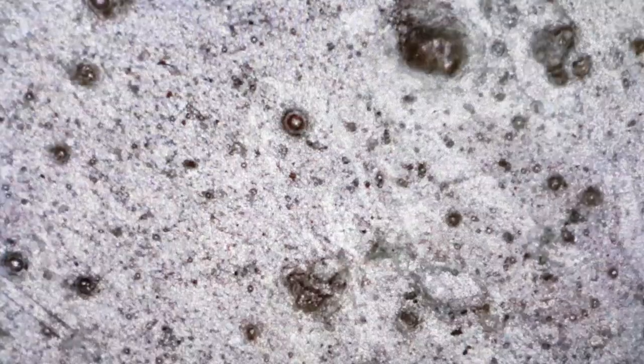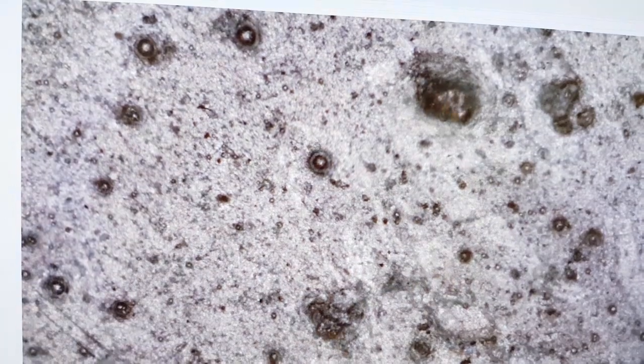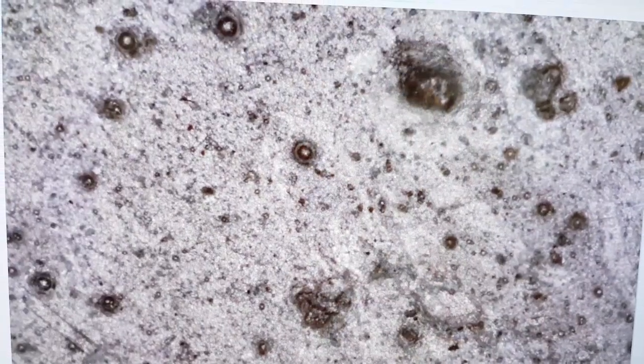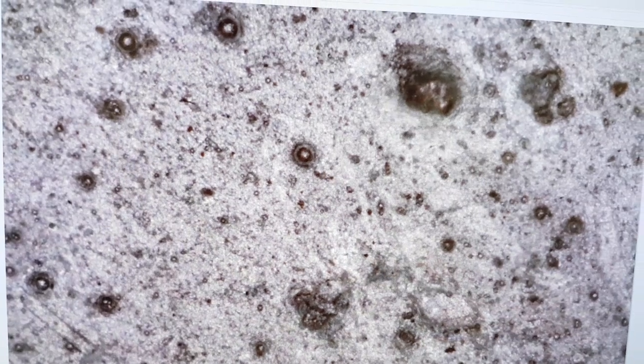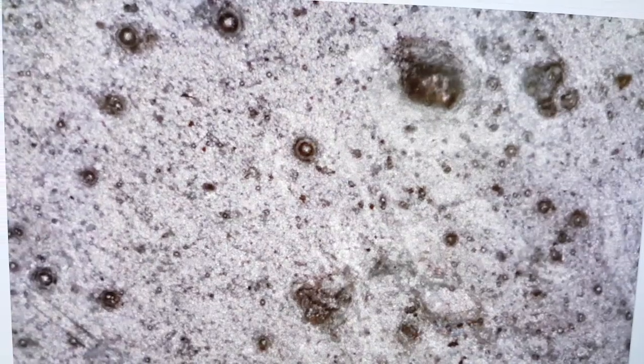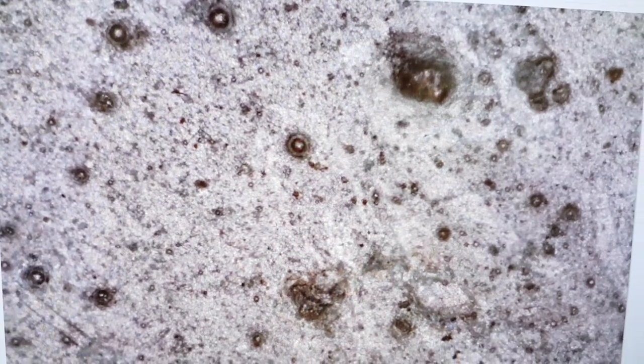What I've done a little further down is taken this image where I've got all the lights on. I'm going around turning the various lights on.